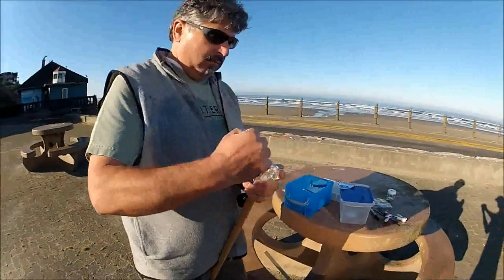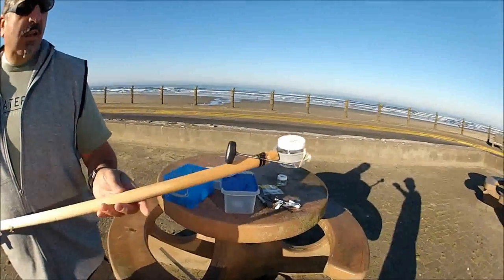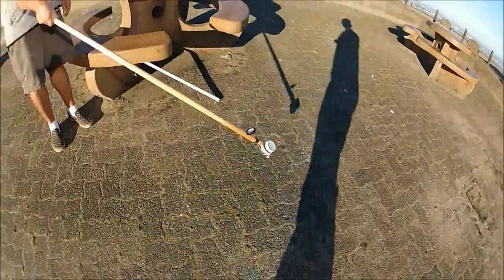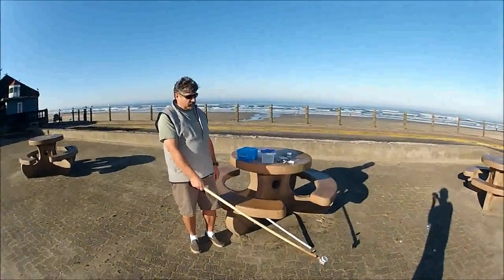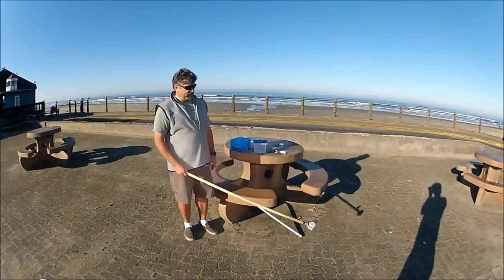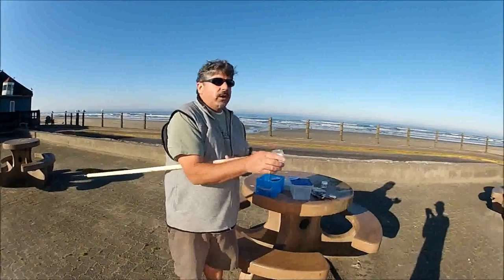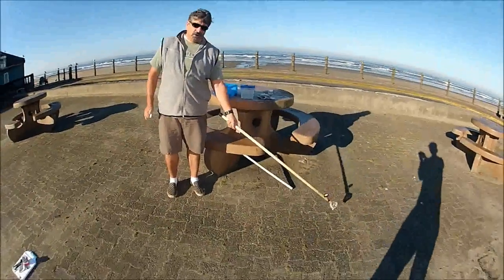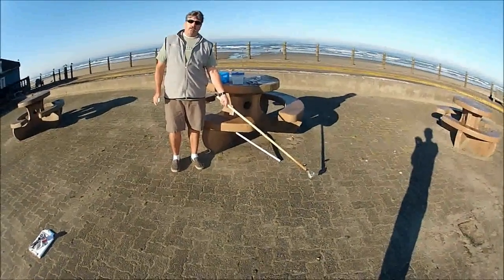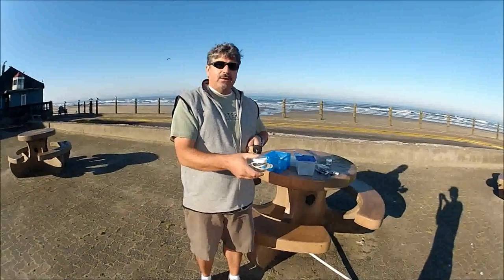We take the lid off and attach the jar to the stick with a rubber band. We take our sample and get a good range so we're not exposed to depth. Out here in Oregon you can see we have a little bit of rougher surf even on a calm day. We take the sample jar off, go out in the surf, get your fill, hold it back on, and you have your sample from a glass non-plastic solution perspective.